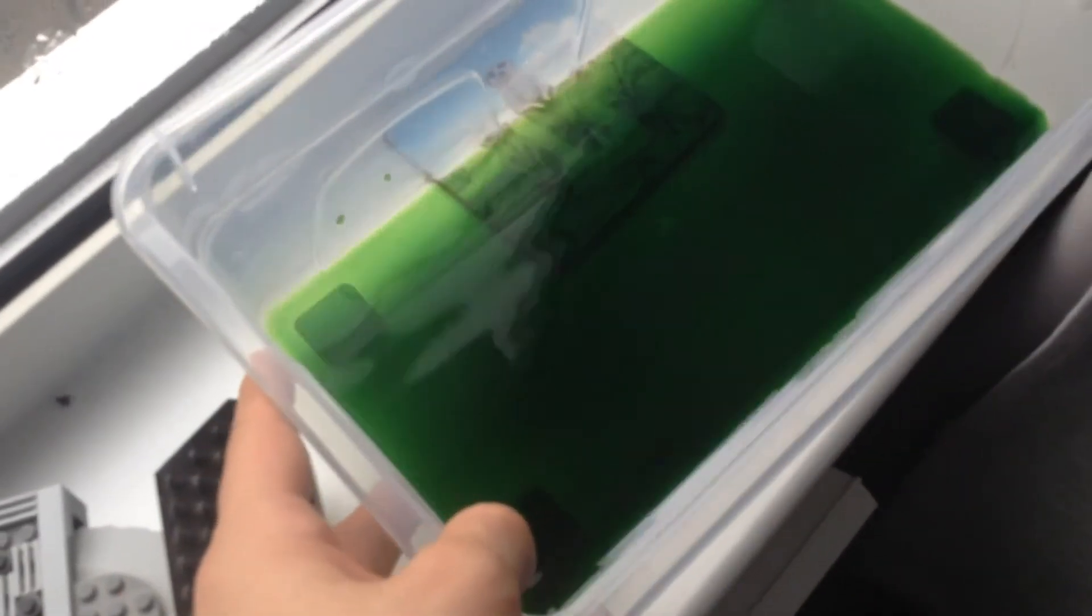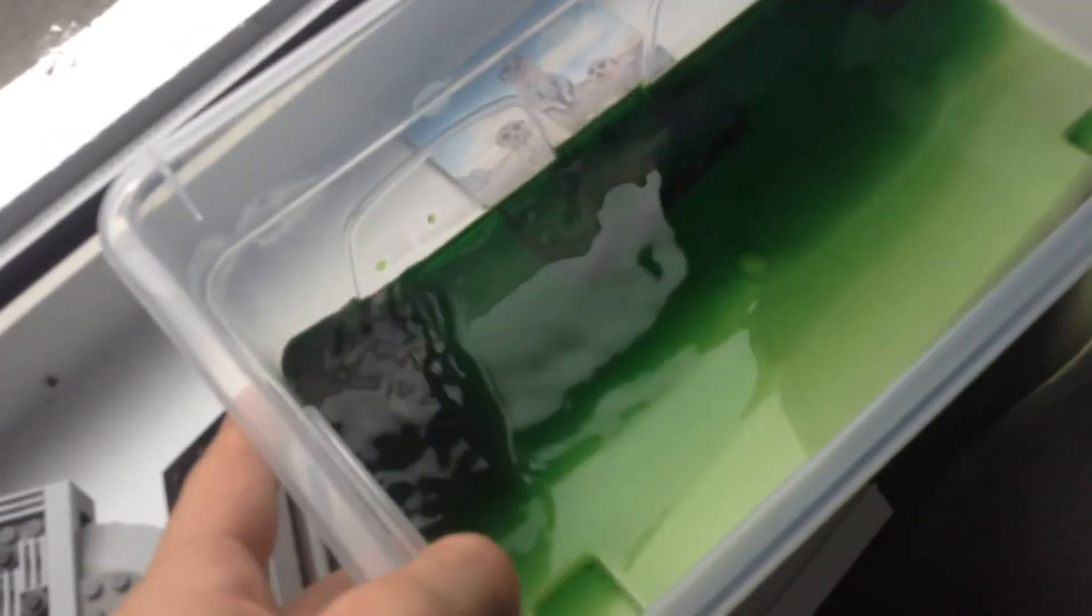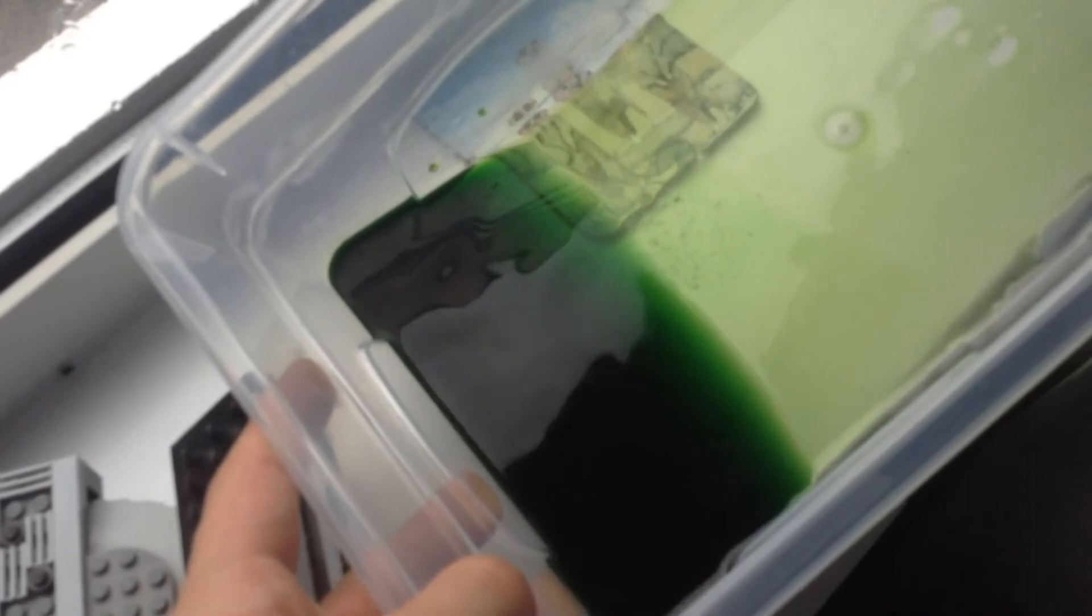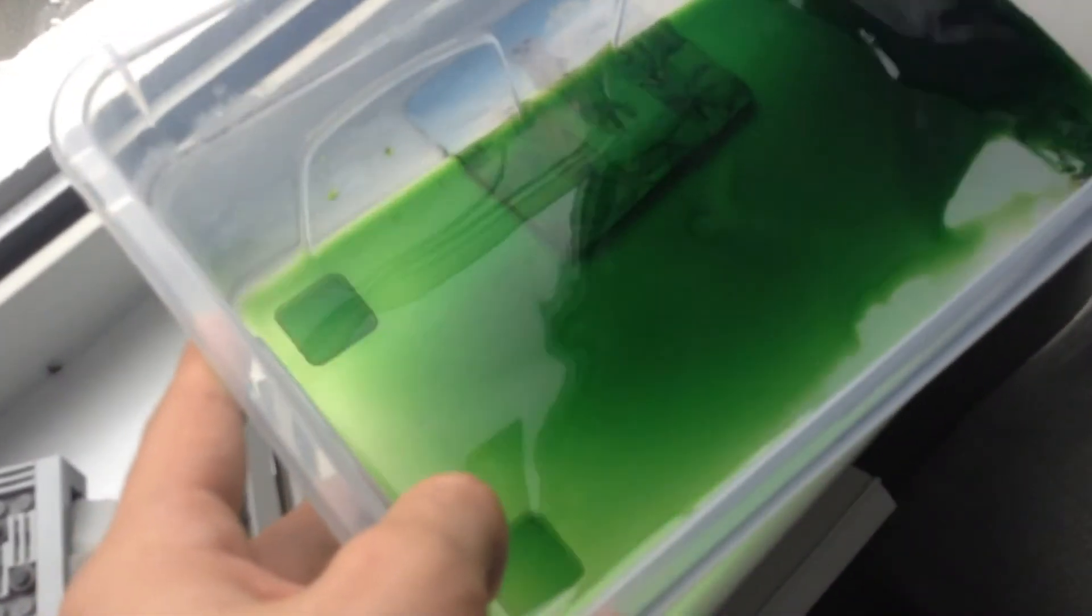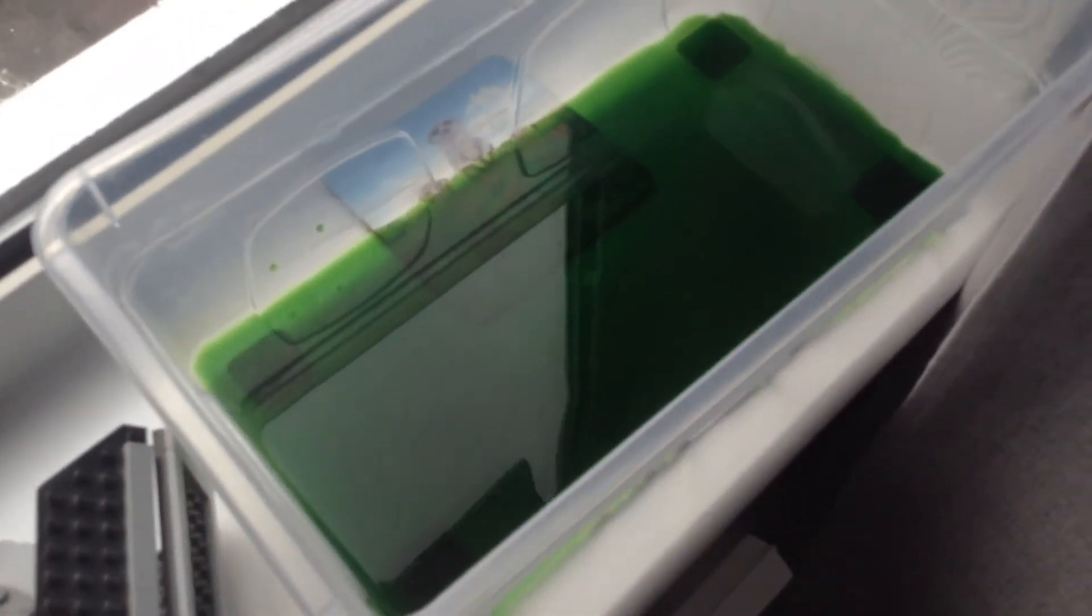Now after all that I'm leaving it out to evaporate and I'll try and heat it up sometimes but I just lack the time to set up a reliable system to quickly evaporate all of the solution.